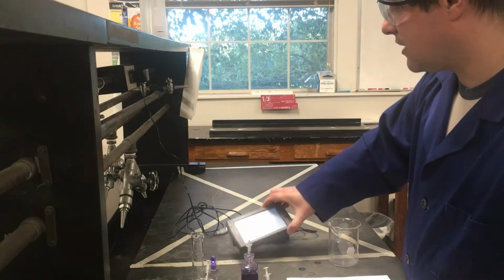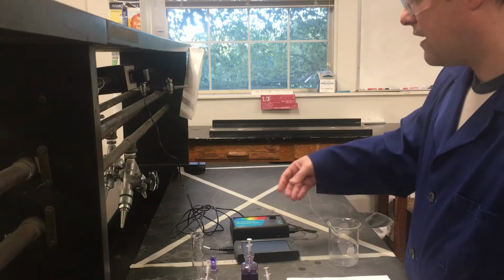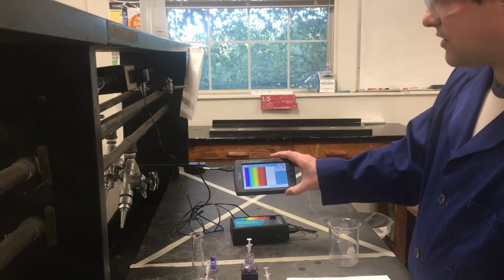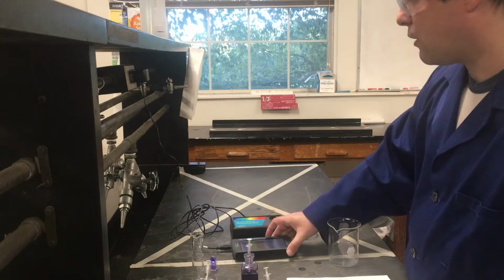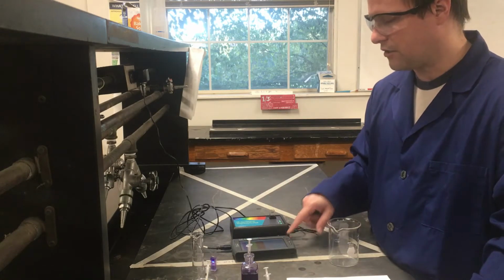And now it says that it's completed my calibration, so I can tell it that's okay, should be ready. And now what it's going to do is start scanning. And I'm going to get a scan that should hopefully be relatively empty. That's fine. And now what I want to do, if I actually want to make measurements, I can go ahead and take this sample out. I can tell this to stop for a second.